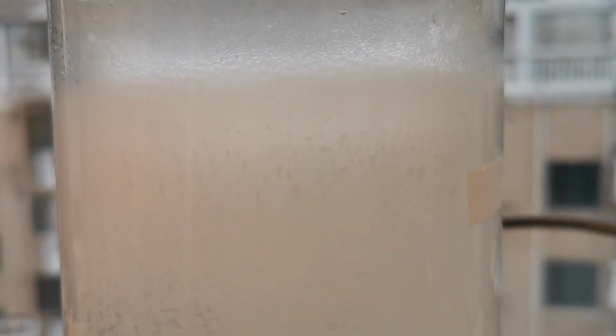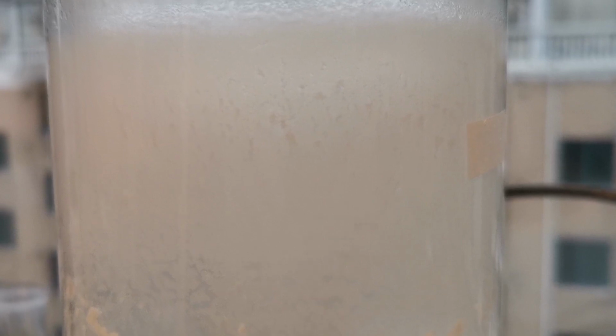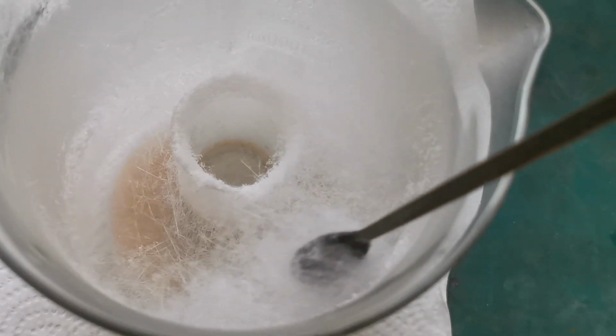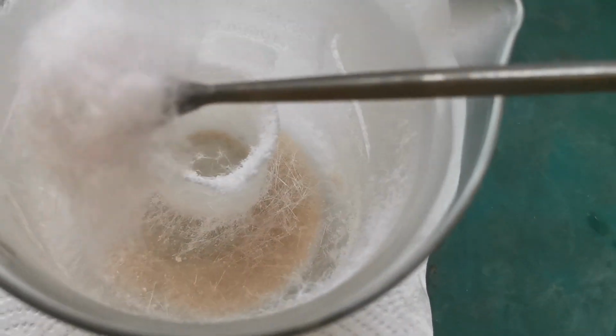Meanwhile, some crystals are already depositing on the upper parts of the beaker. Their fluffy appearance proves that they are phthalic anhydride crystals. After a decent amount of crystals deposited, I removed the beaker off the hot plate and allowed it to cool. I then scraped off the crystals with a spatula. I found the small beaker useful as it can support the crystals from falling down into the phthalic acid melt.